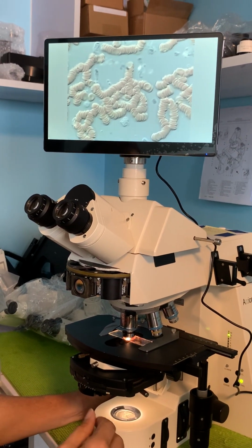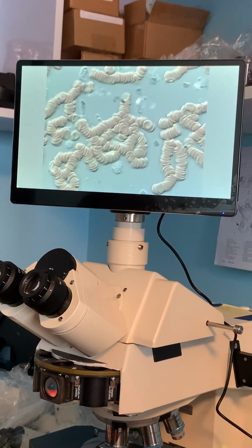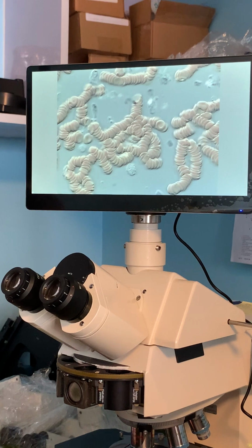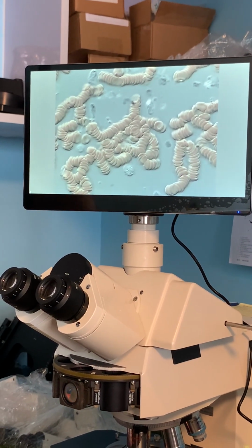So this is a live blood image showing our red blood cells using a 63 Plan-Apochromat objective lens with oil immersion under DIC. Okay.